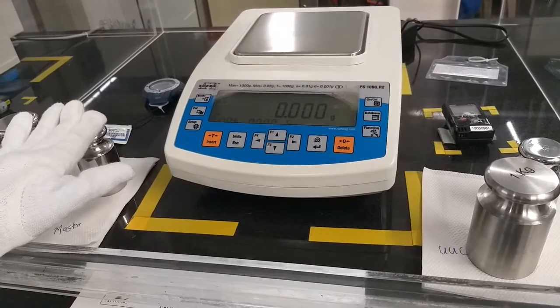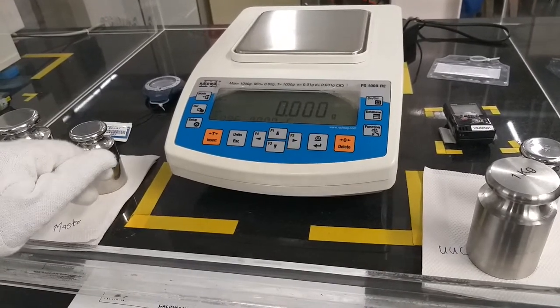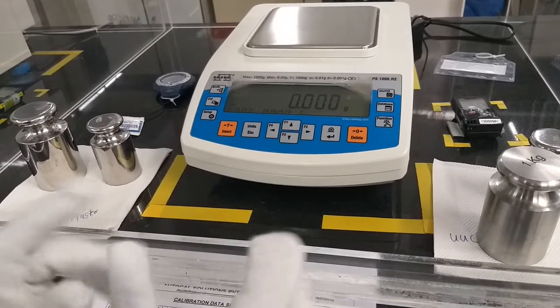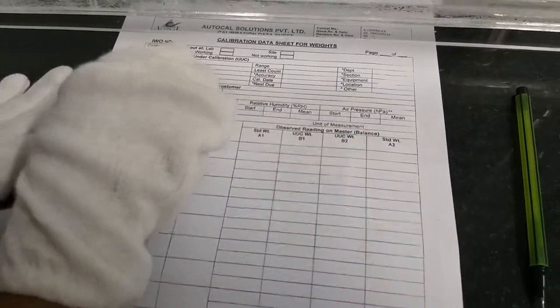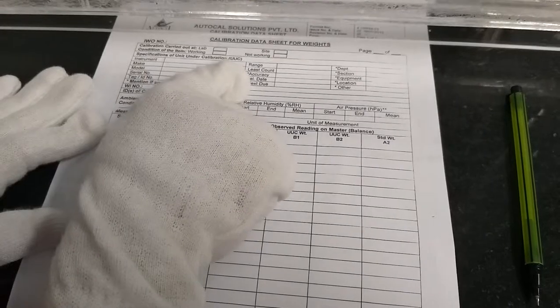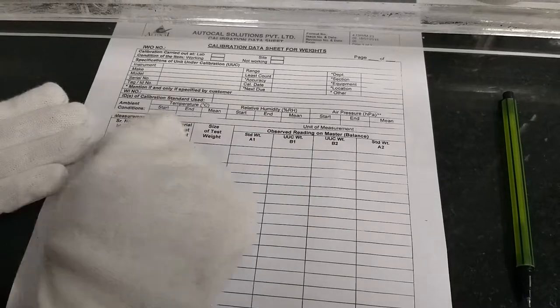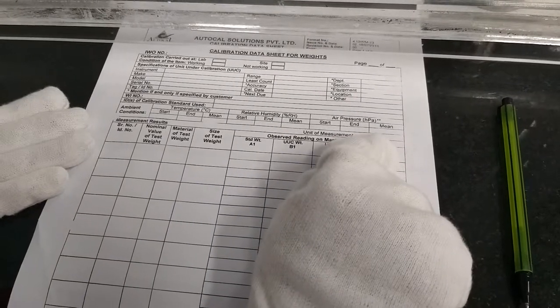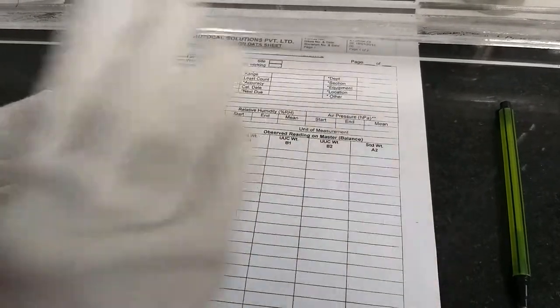After cleaning the weights, we keep them for soaking for approximately 30 minutes. After 30 minutes, we take the weights and start calibrating. But before calibration, we have to fill a datasheet: the work order number, name of the instrument, make, model, serial, ID, range, starting temperature, ending temperature, relative humidity, air pressure, and unit of measurements. The unit in which we are going to take measurements is grams.